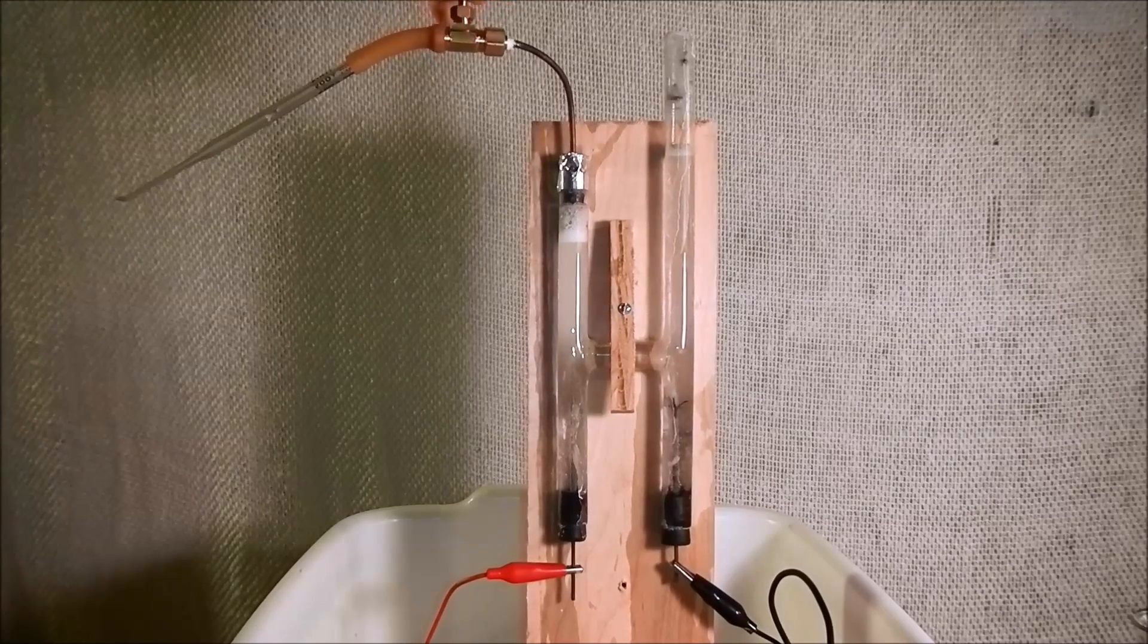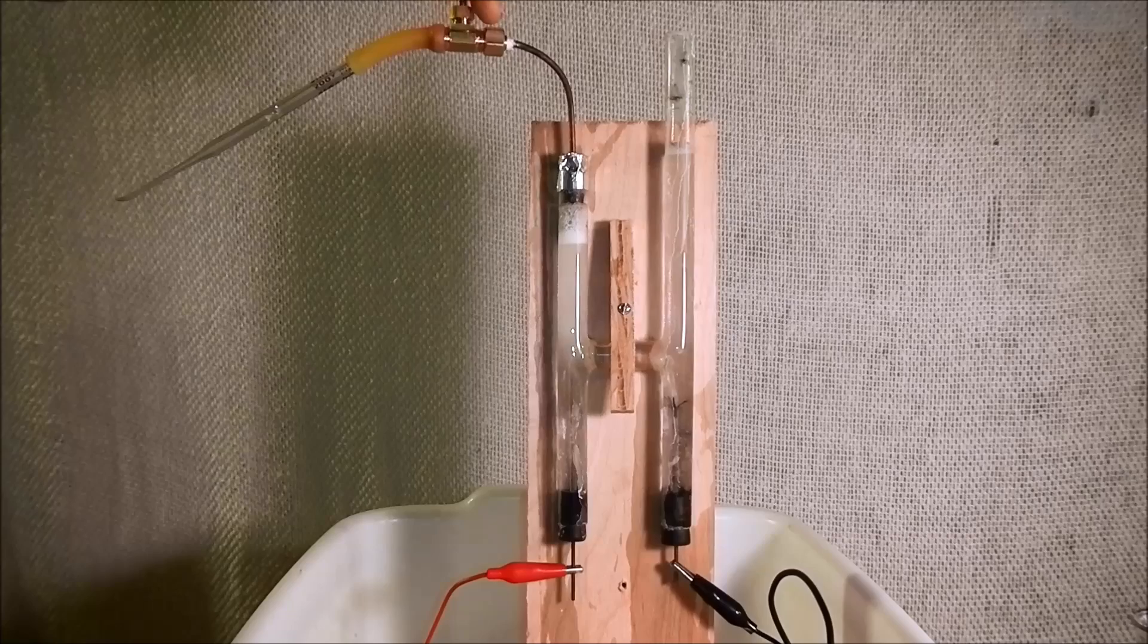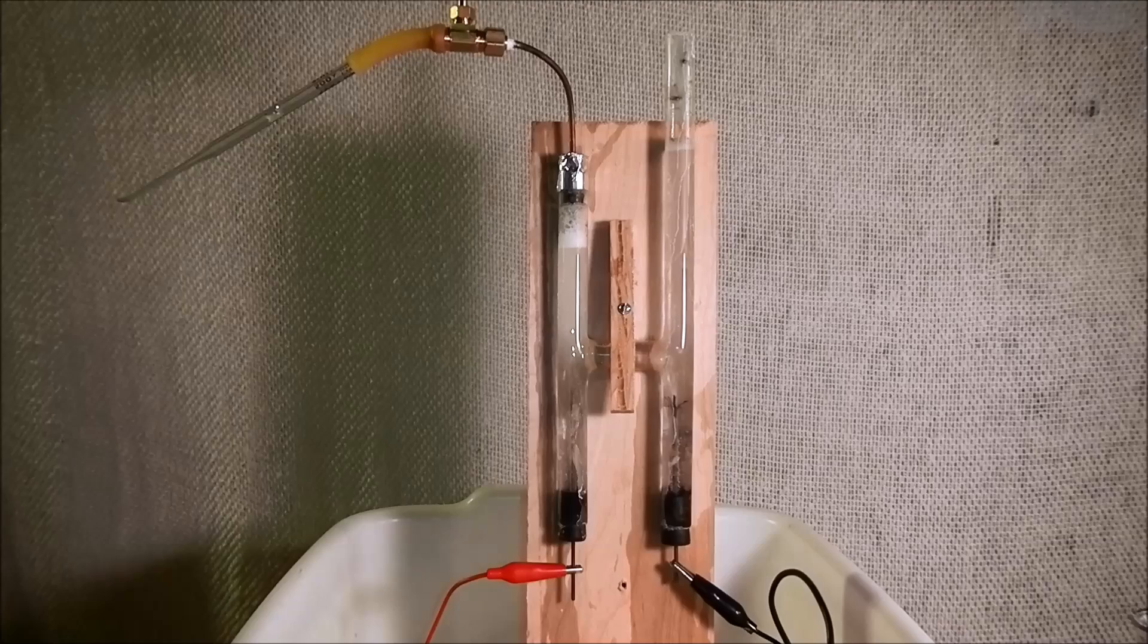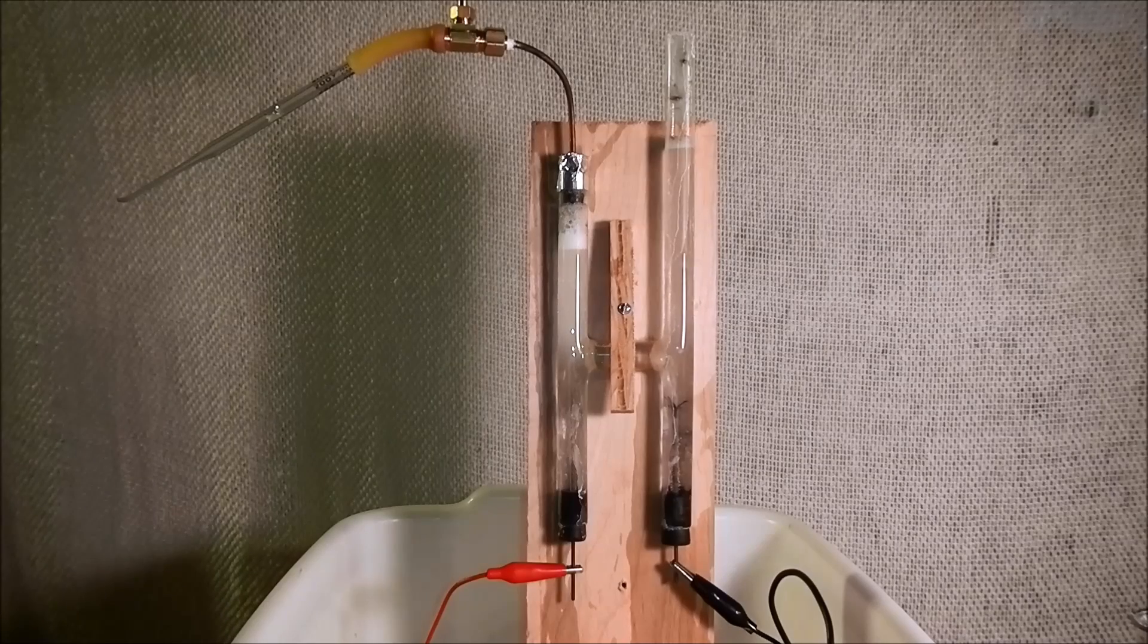Now, I'm not sure if you're able to catch that on camera, but there was a little bit of a flame from the hydrogen, and I'll close that valve and start accumulating our hydrogen gas again.